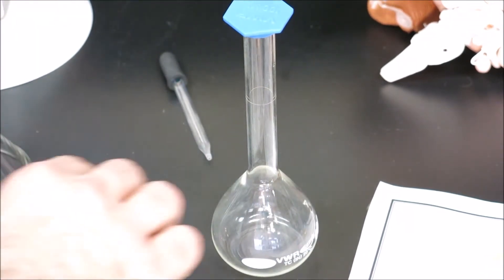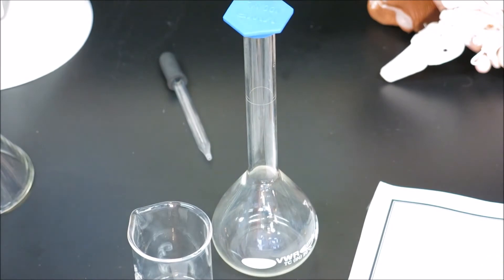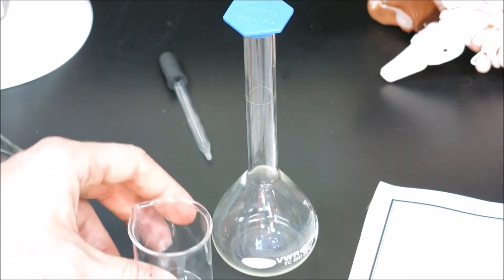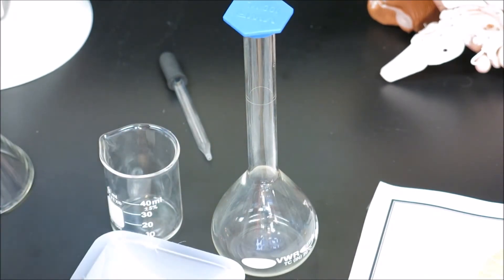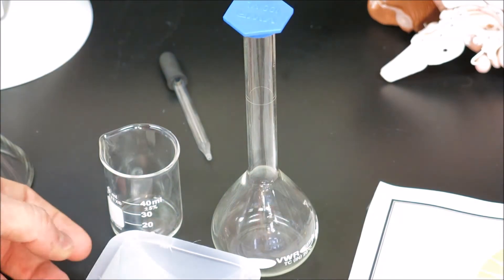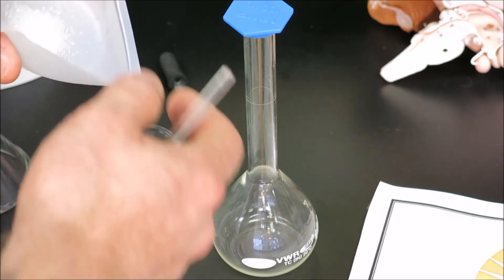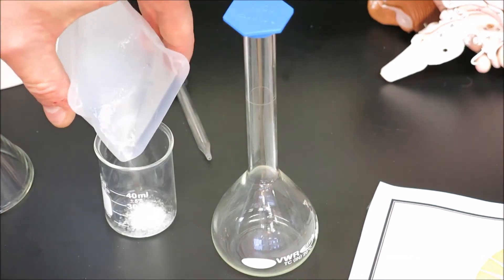We have a small beaker, and our solid will go into that beaker using a small amount of distilled water. If I pour the solid into the beaker, not all of it makes it in.